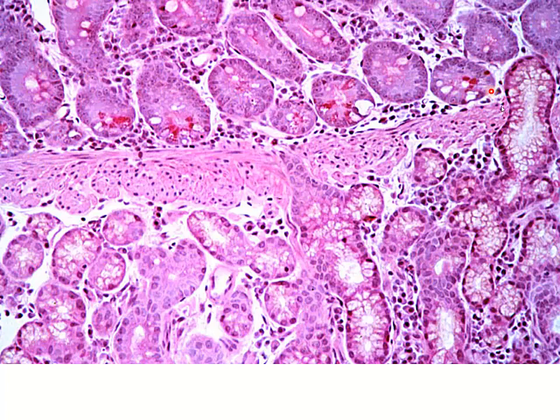And so these are our mucus producing Brunner's glands, and here you can see one of those extending up through the muscularis mucosa, emptying into, we can't see exactly where it empties, but it's going to empty into the bottom of one of our crypts of Lieberkühn.